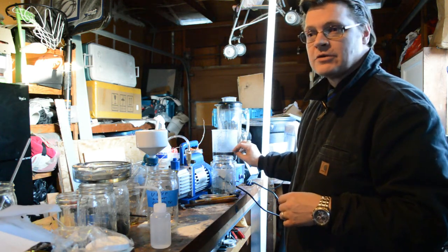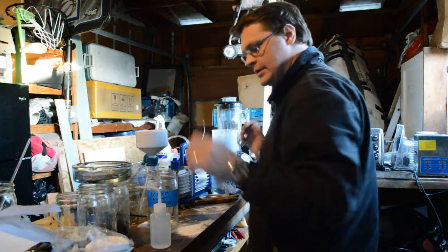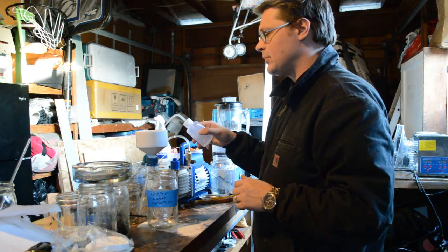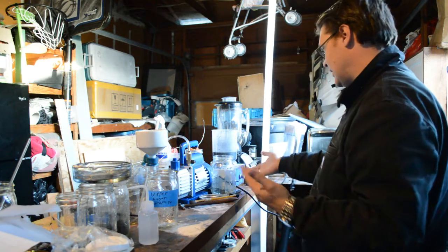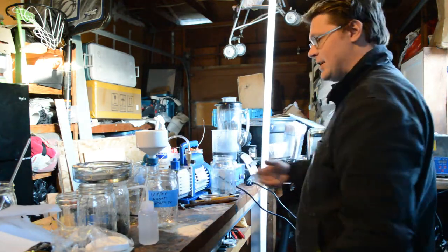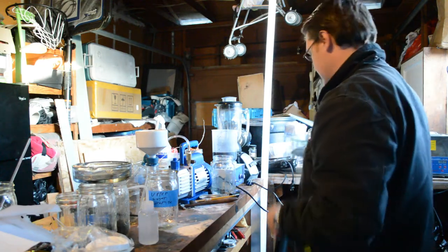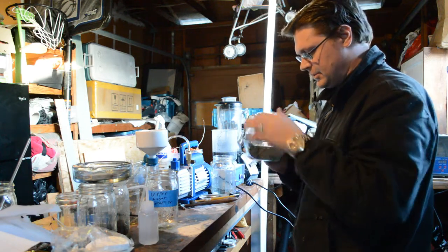This is all the stuff that was collecting at the top layer of that solution. This is the last half of that — I split it down into two because I didn't want to make a very large solution. It's easier to filter off. It only takes me about 30 seconds to do that. And then once I get done doing that, I dry it in my oven here and you get this little product here. It's pretty fine, pretty dry.